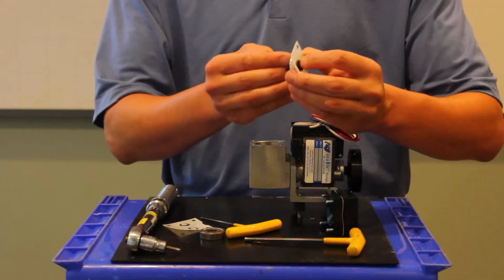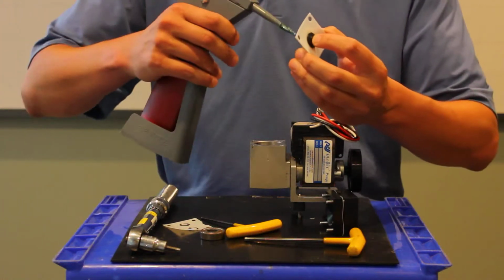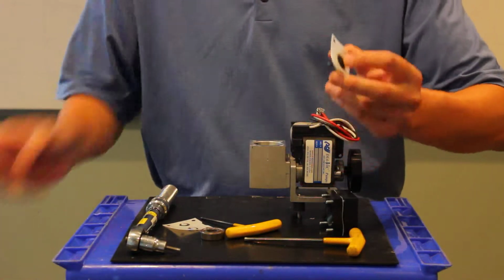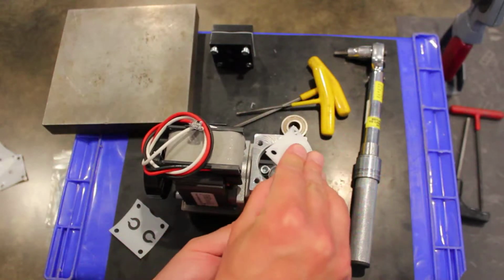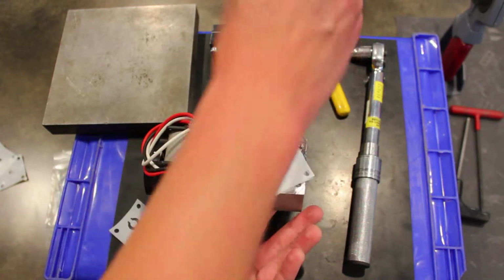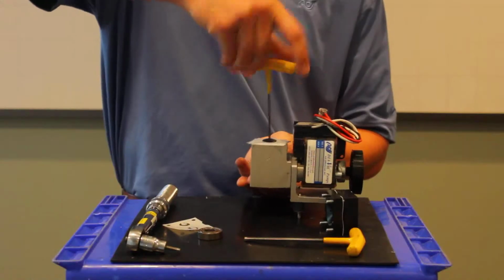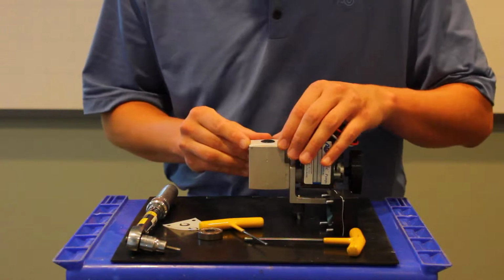Now what we want to do to prevent this from backing out is use a medium strength thread locker, like a Loctite 242 blue. Put a little dab on the end of the threads there. And then we're going to line up our connecting rod. I like to use my left hand on the back side to line it up right. And I just want to get it just started, just a thread or two, so I don't lose it. And then without getting too tight, I'll make sure everything's lined up.